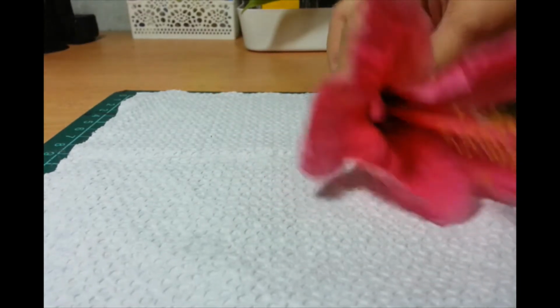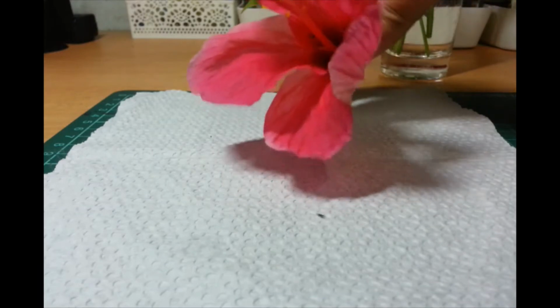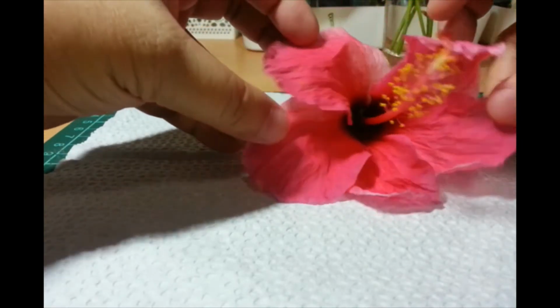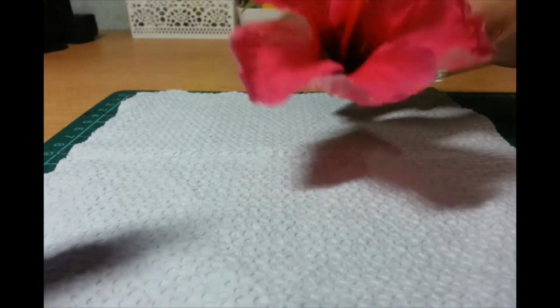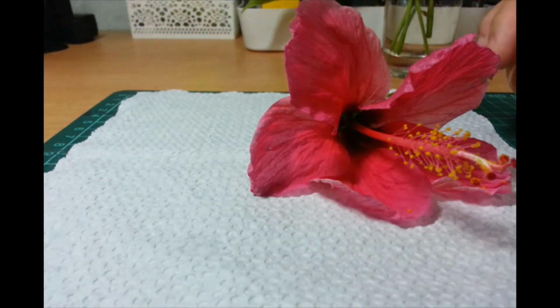As you can tell, it's very colorful. It actually blooms during the daytime. So, a day-blooming flower is colorful. It has large petals. There are so many ants. It has large petals, and it's very attractive. You can have different types of pollinators, usually insects and other animals, that are attracted to the coloring of the flower, and the petals are big and bright, so you can see it from afar.